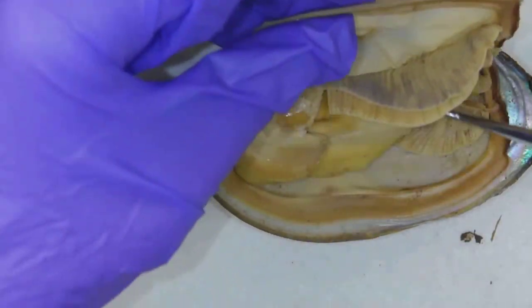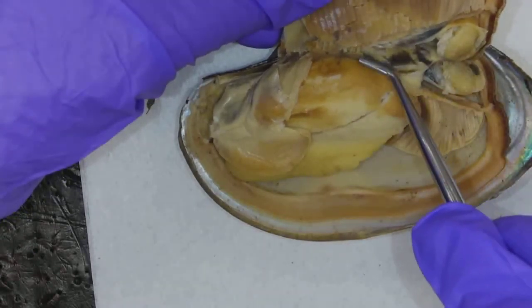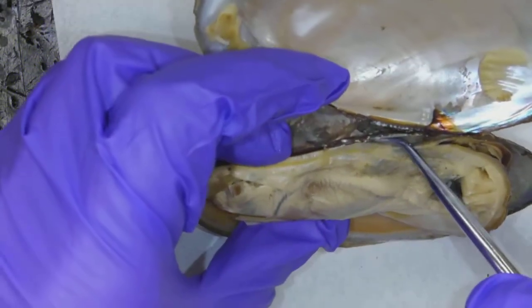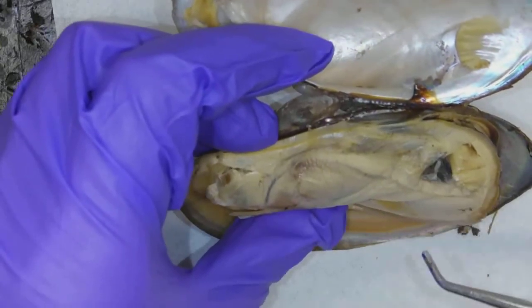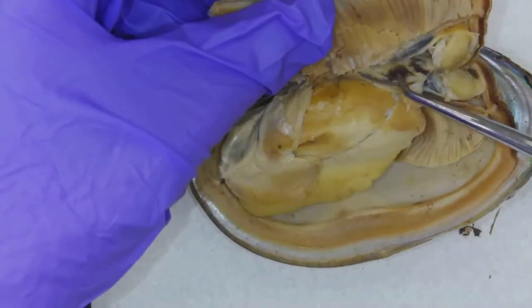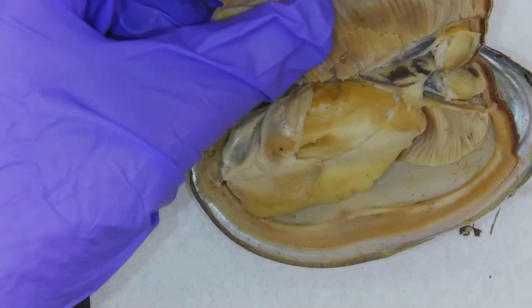What else do we have to look at here? Well, the heart. Where's the heart? The heart is located up here — it's dorsal. The kidney is very tricky. I'm not going to dissect for the kidney — I'll leave that to a diagram. The kidney is located up here; it's this brown structure in here, but it's often hard to point to on a dissection.